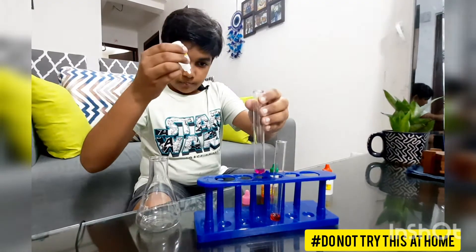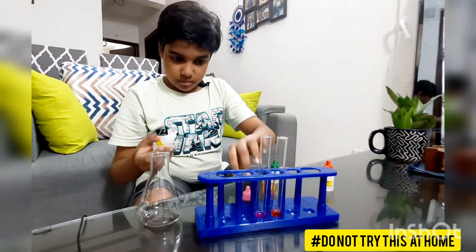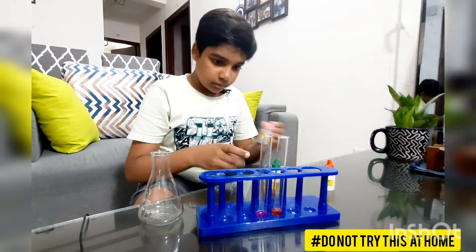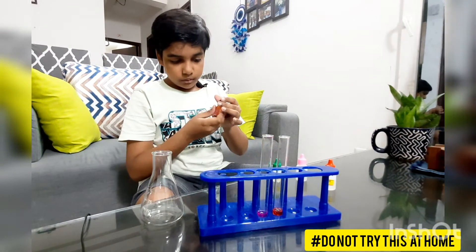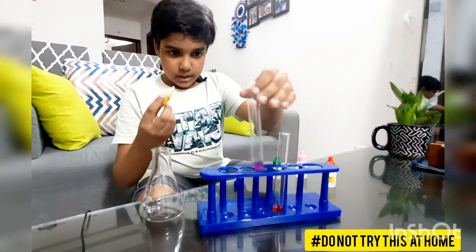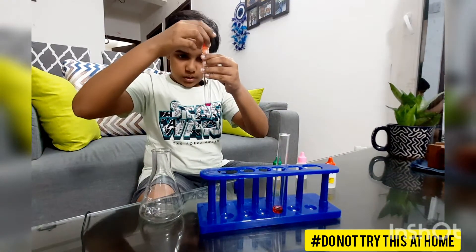Let's see what the effect will be. Although it's appearing a little pink, let's observe the result.